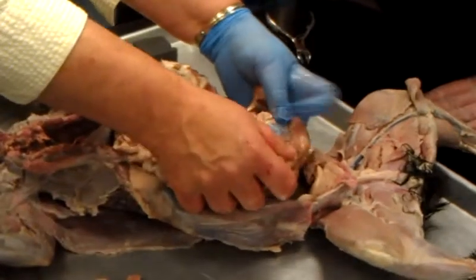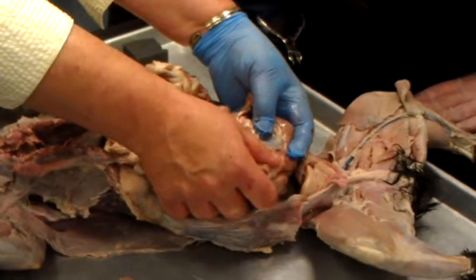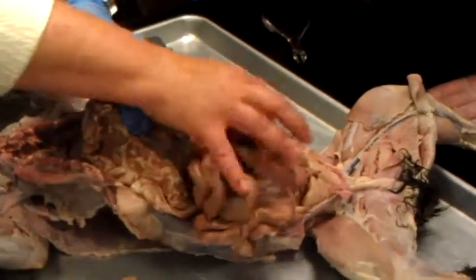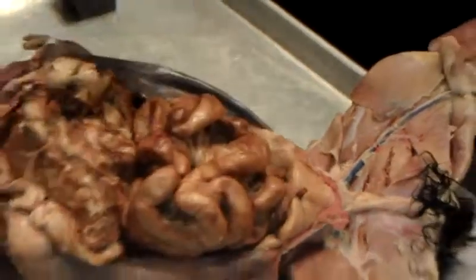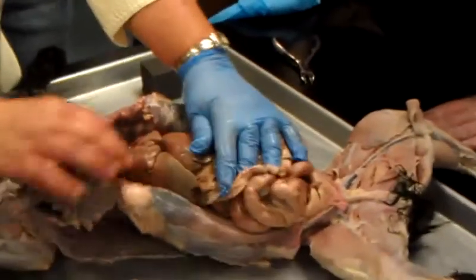Mesentery should be between the loops of the small intestine. See it? And who remembers the mesocolon? I said it attached the large intestine to the back of the body wall. Does everybody see it right there? Oh, yeah. That's your mesocolon. I'd get all my membranes first. Okay. Now, let's start with the organs.